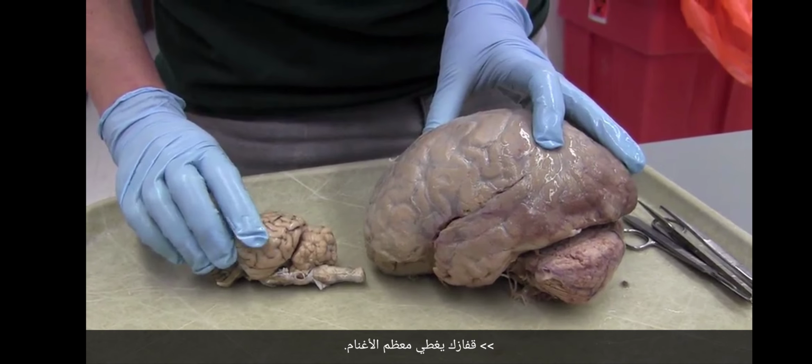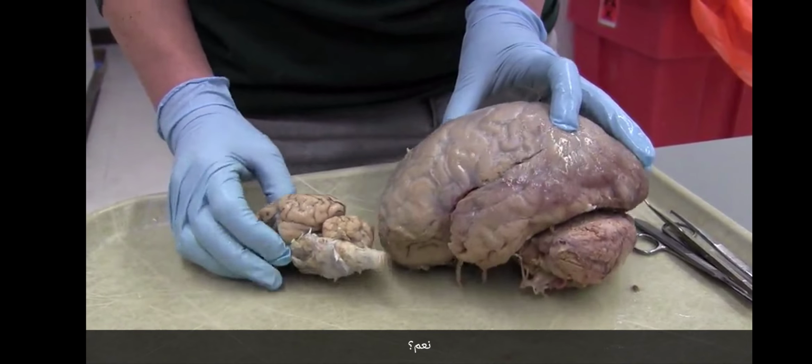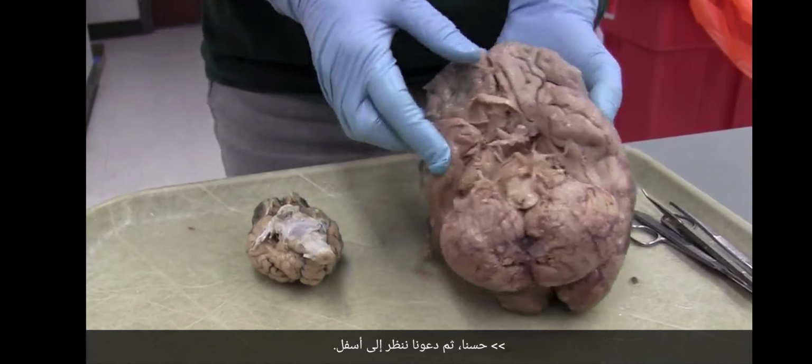Is it going well, Sol? Yeah, your glove is covering most of the sheep. Okay. Yes?